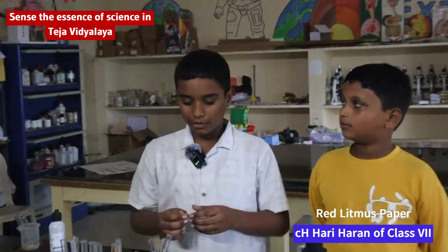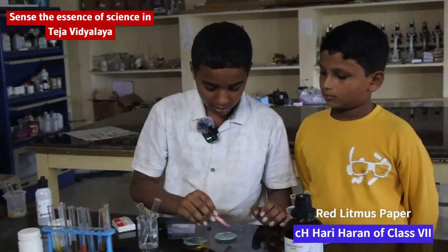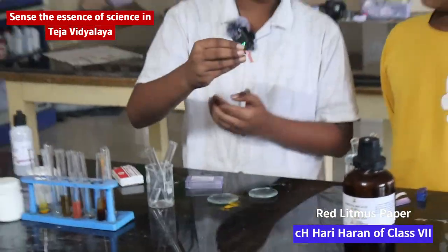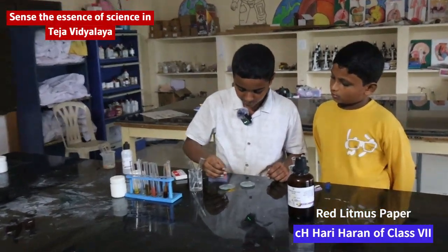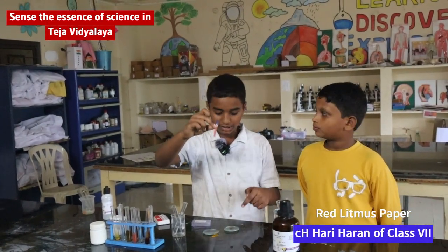I am Hariharan. Now I am testing red litmus paper with acid and base. This is acid. When I dipped it in acid, it didn't change its color. Now I am dipping it in base. When I dip it in base, it changes to blue color. So this is acid and base.